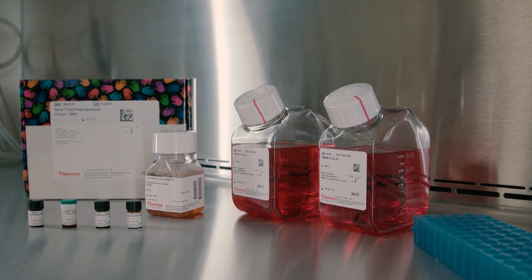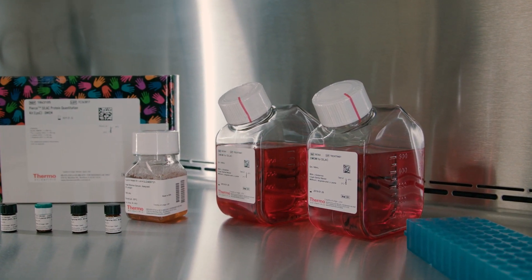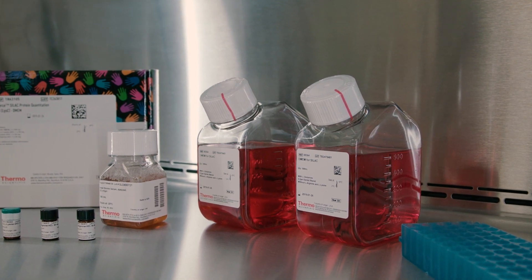All reagent preparation and cell culture must be done in a tissue culture hood under sterile conditions to prevent contamination of your cultured cells.